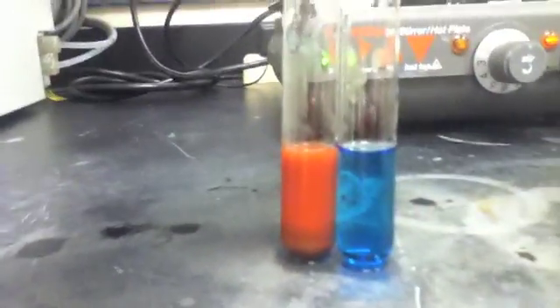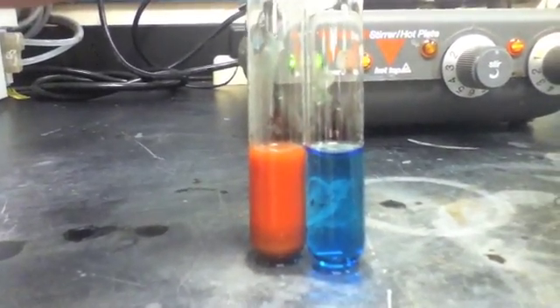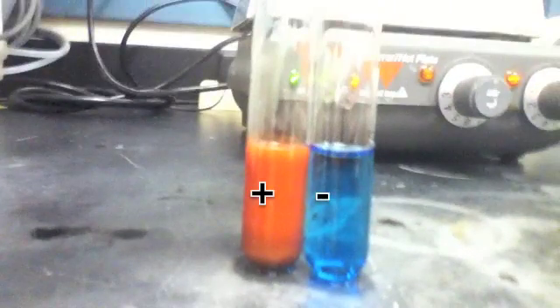Again, notice the opaque brownish-red coloration of the positive control compared to the translucent blue of the negative control.